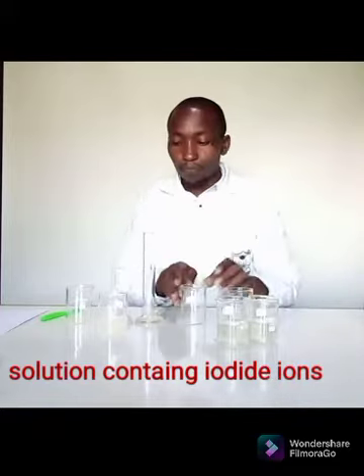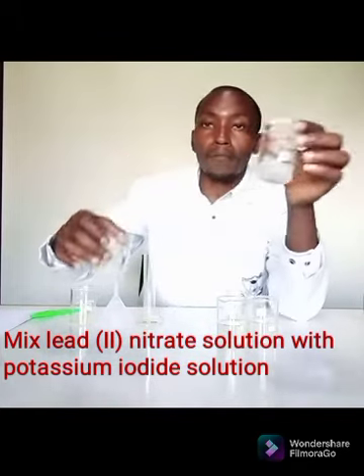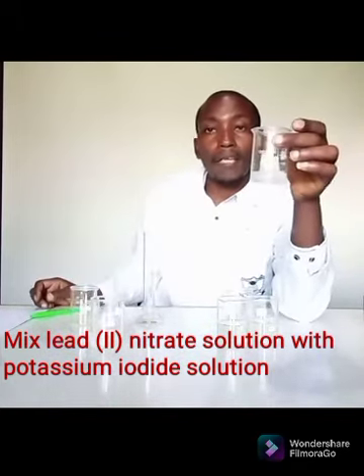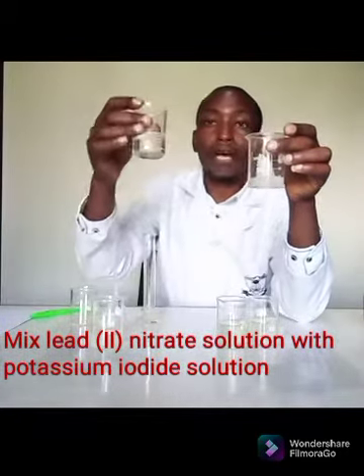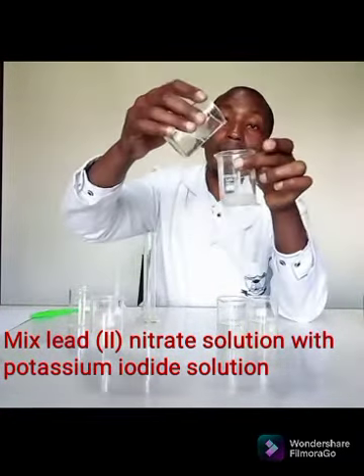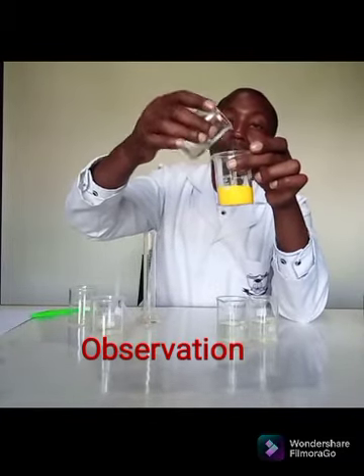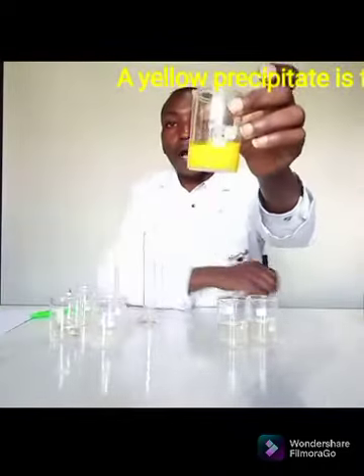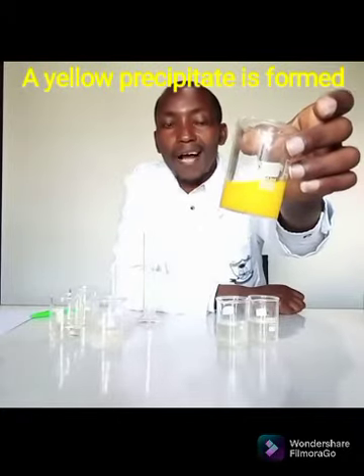So what do I need to do? I need a sample of the lead II nitrate. Like now I'm using lead II nitrate, so I'll have a sample here. That is a little sample of the lead II nitrate salt. Then I will bring in a little sample of the potassium iodide. I will add potassium iodide. Good. You can see a yellow precipitate has been formed. A yellow PPT has been formed.